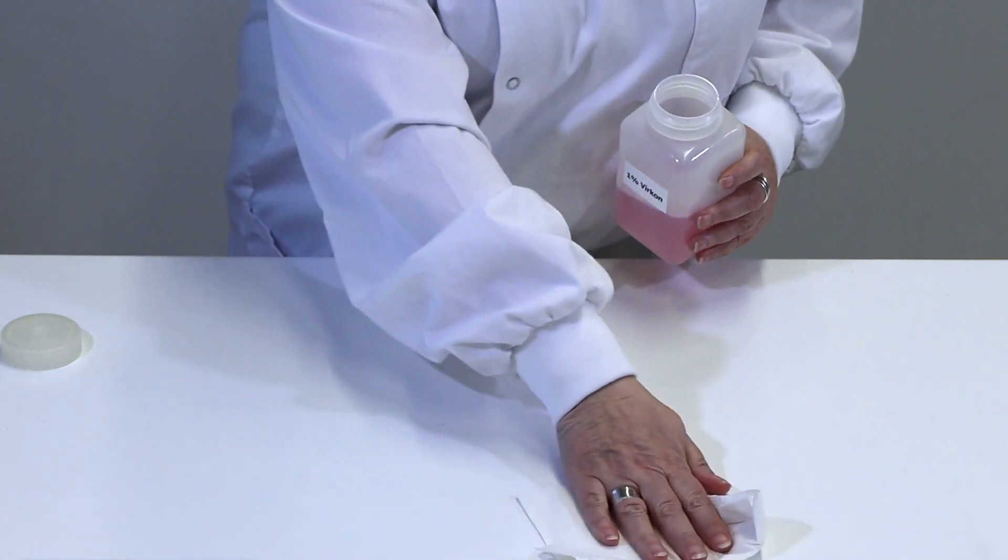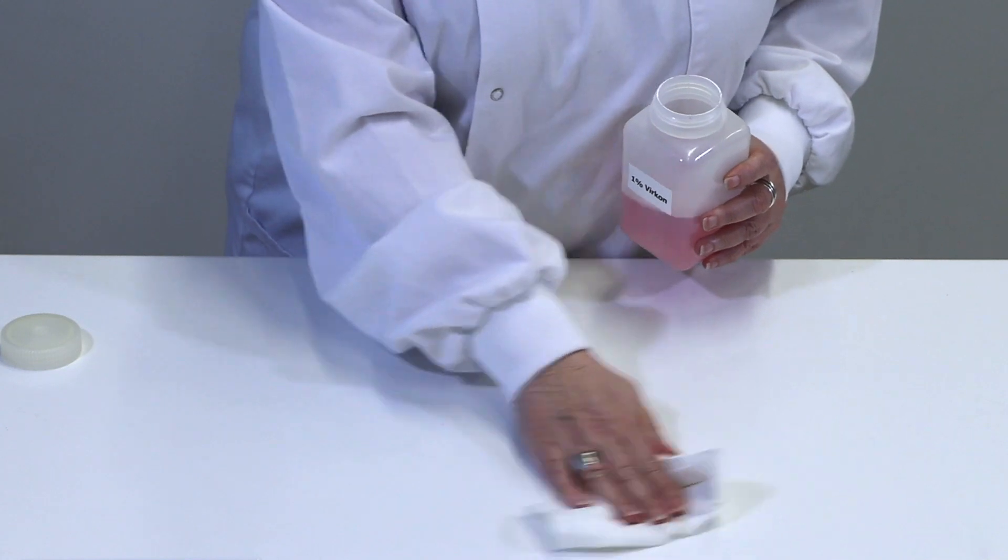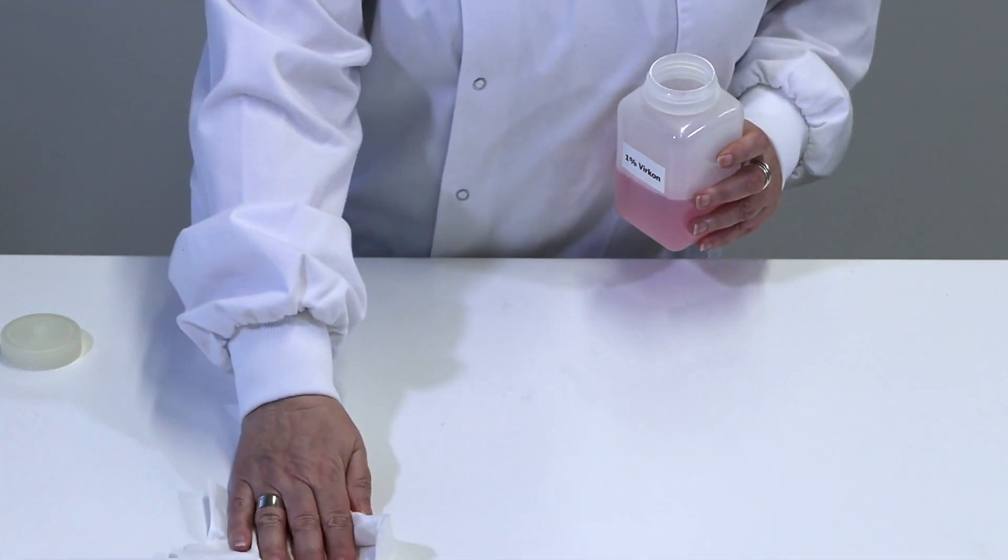We're going to mop down the area that we're going to be working in. The tissue that I'm using here will be put in an autoclave bag for disposal.